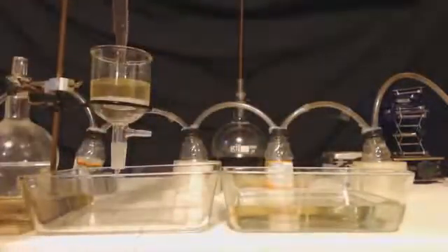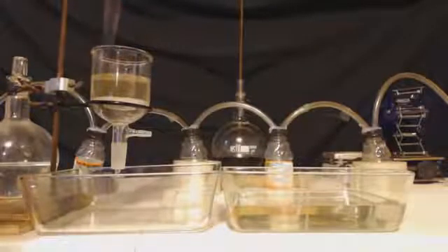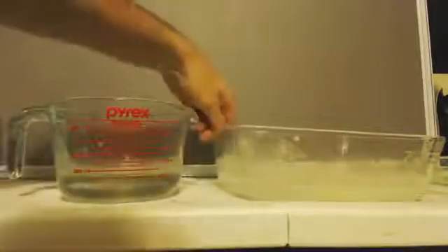You'll just have pure, clear liquid. You can see there that's after about three or four weeks - stuff's floating in it, settled at the bottom, climbing up the sides. You just got to keep waiting until that liquid gets down to just a little bit, and then filter it out. This is like slush right here.